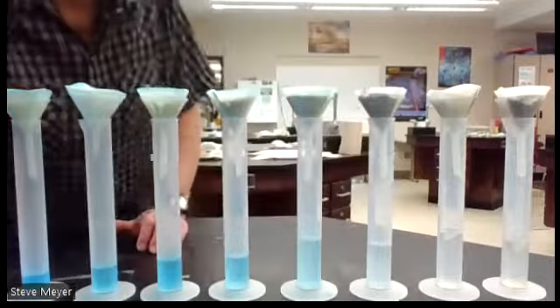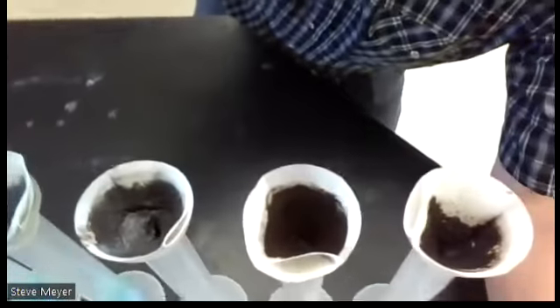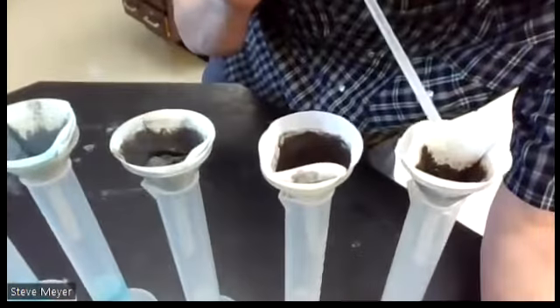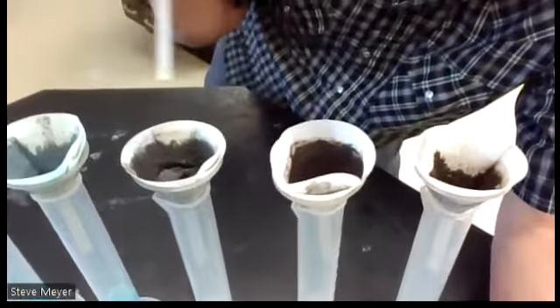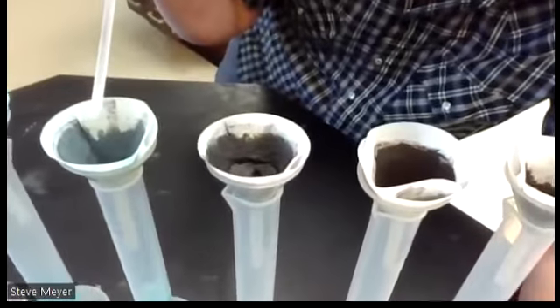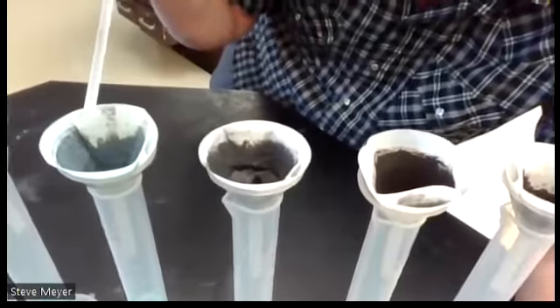Just one other visual so you can see these precipitates. We'll try to do this with this camera here, not too good with this. I'm looking over here, and let's see if I can point in here with something. This is test tube 1. You can kind of see that black. Test tube 2, blackish precipitate. Test tube 3, black precipitate. Test tube 4, it's a little bit of a mix between gray and some blue spattered in, but a darker gray. Let's look at these other ones here.